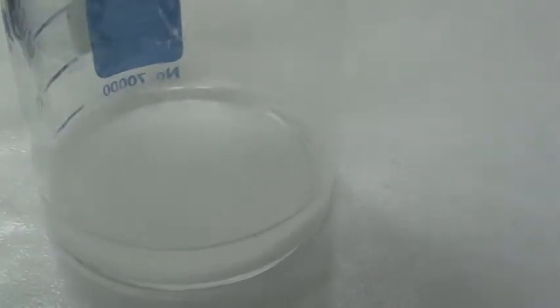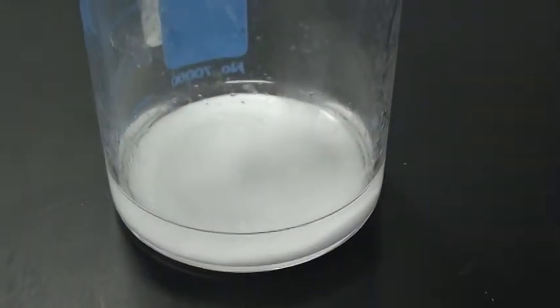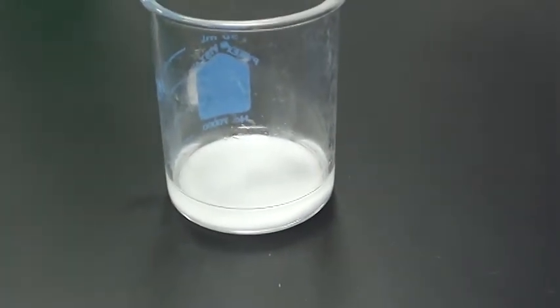Notice the reaction. Please note your observations. This concludes the Physical and Chemical Changes lab.